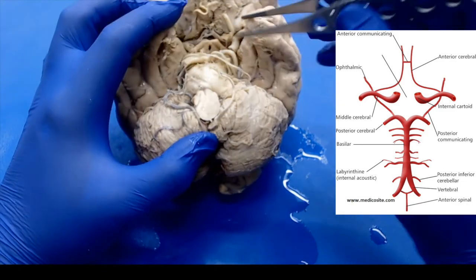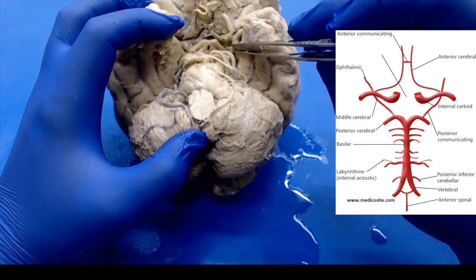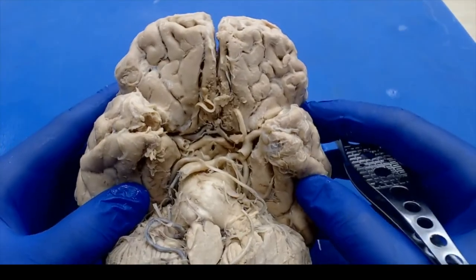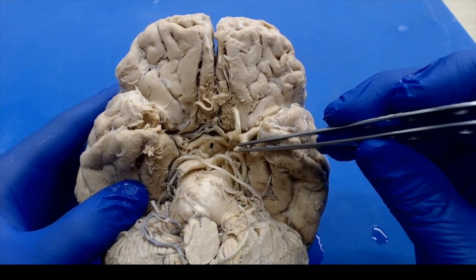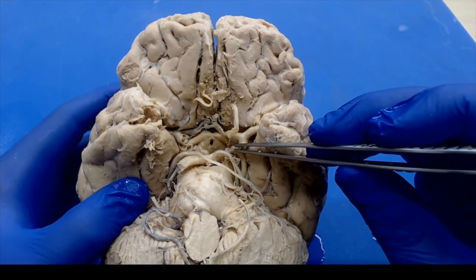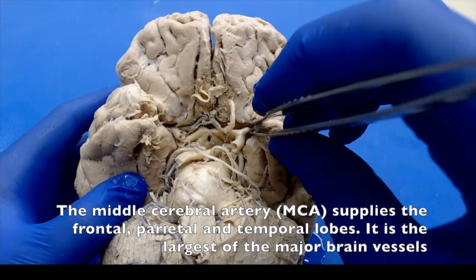Now, most brains you should be able to see a cut internal carotid, which we see here. And let me zoom in a little bit so you can appreciate these structures. So the cut portion pointing inferiorly, that's your internal carotid. And that's going to be the anterior supply of the circle of Willis. And coming almost immediately from that, you should be able to see the middle cerebral here.